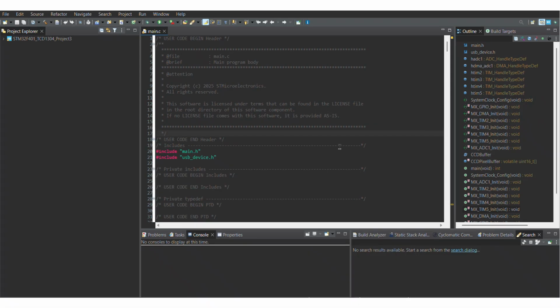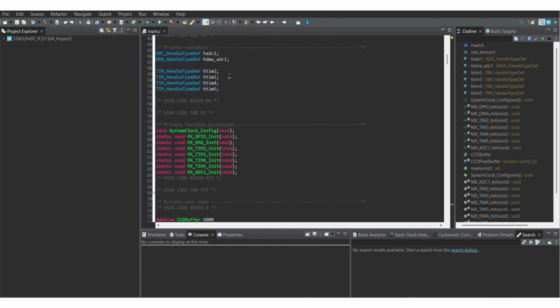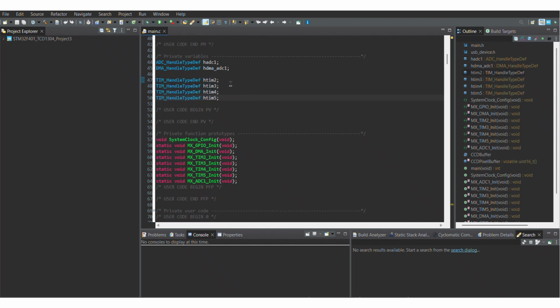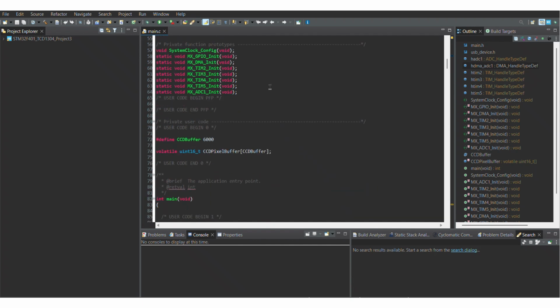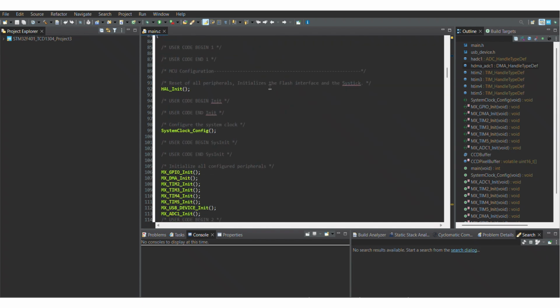Here we have the STM code written in the STM-Cube IDE. Here we have the 6 peripherals used. Those are the 4 timers used to drive the CCD, 3 of which control the input to the CCD. The remaining is for the ADC, which you can see here. The DMA is used to transfer the data, and then the ADC peripheral is above it. There you have the buffer used to store the output before sending it on the USB.